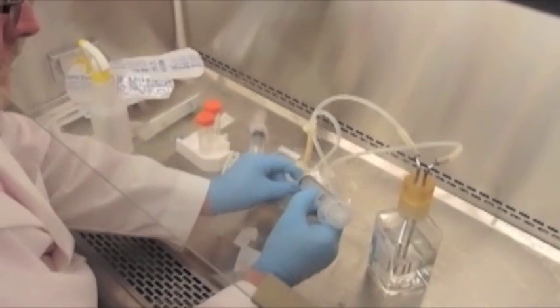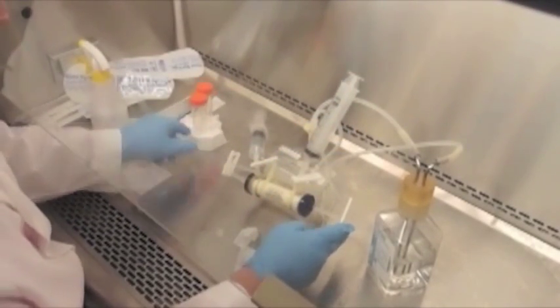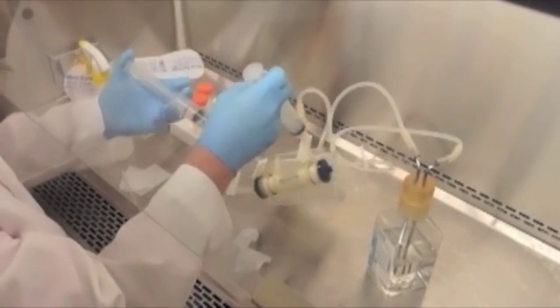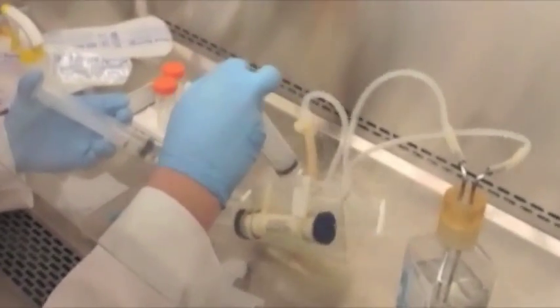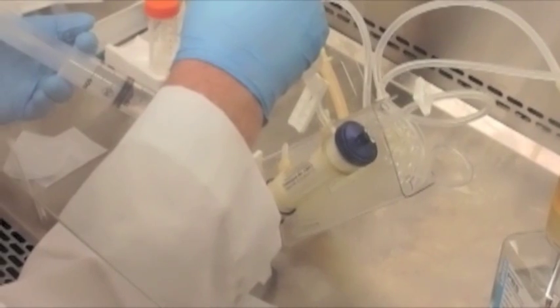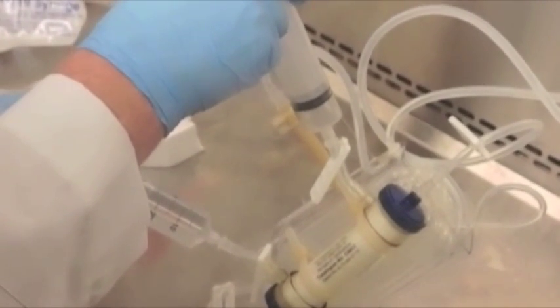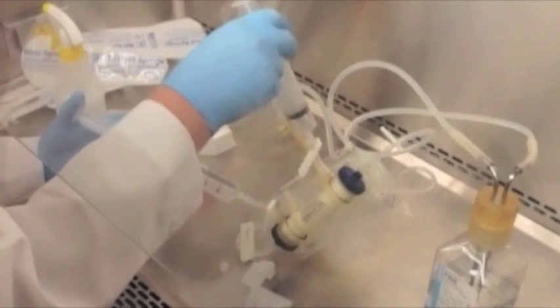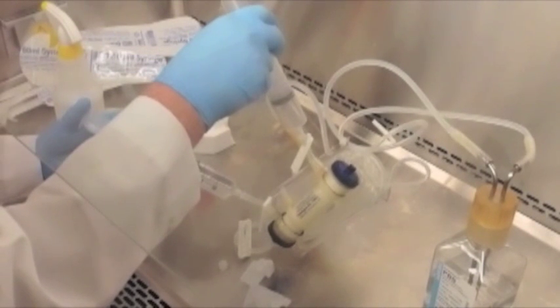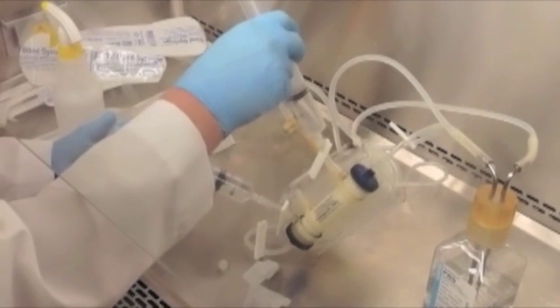I'm going to attach a second syringe to the right side port. With the end ports closed, we'll now open the side ports and fill the extracapillary space with PBS. Tilt it up so that the air goes into the right syringe first. We want to slowly fill up the extracapillary space. And then as soon as we see liquid showing up in the right syringe, that means the extracapillary space is filled.